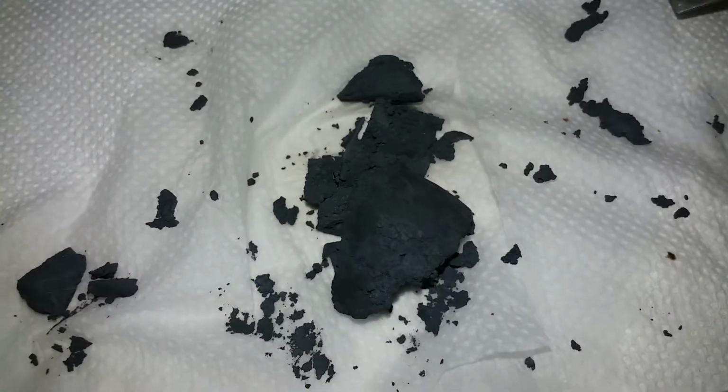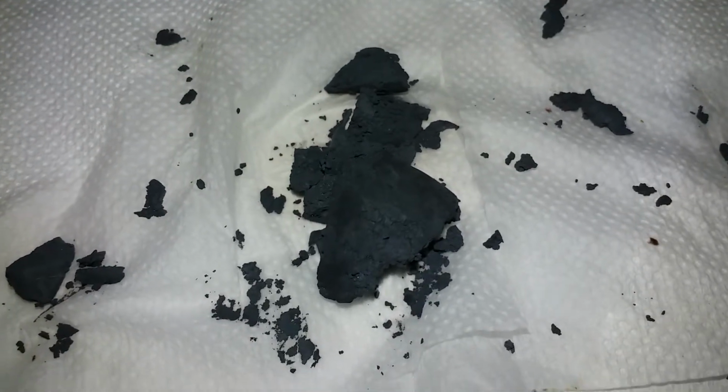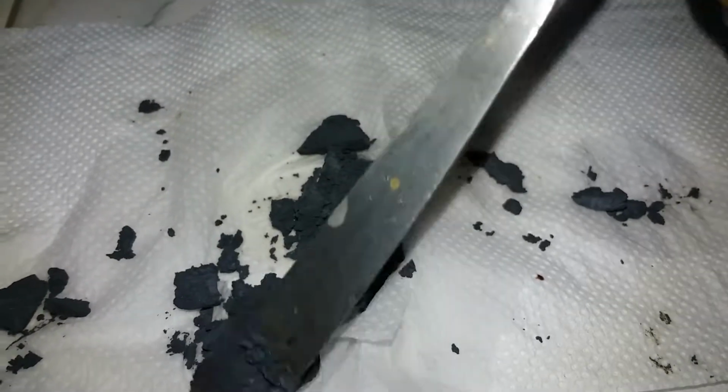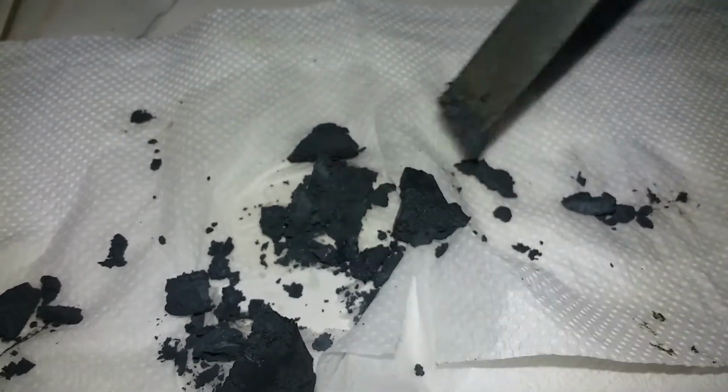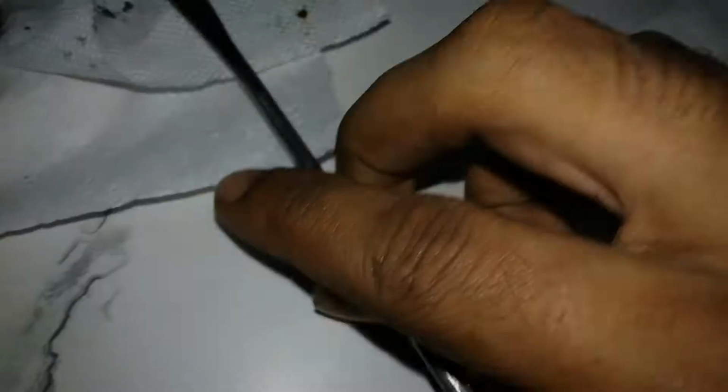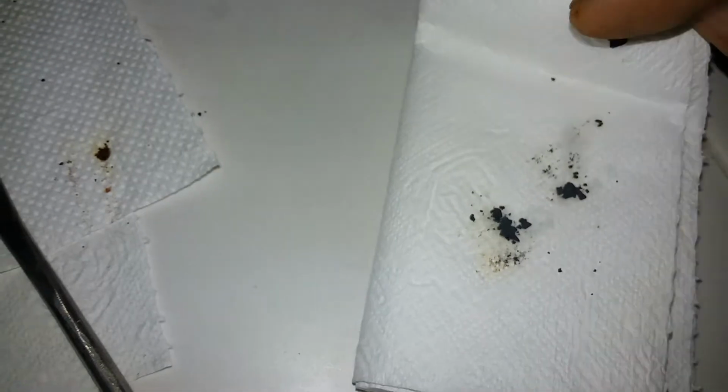Okay, so what I like to do is just break them up into smaller pieces. Oh shoot. Okay, and then take a paper towel and transfer them onto this dry paper towel, and then sponge them out, like doing this. Yep. So then you have a pretty dry iodine. Okay, I'm gonna check in when I'm done.